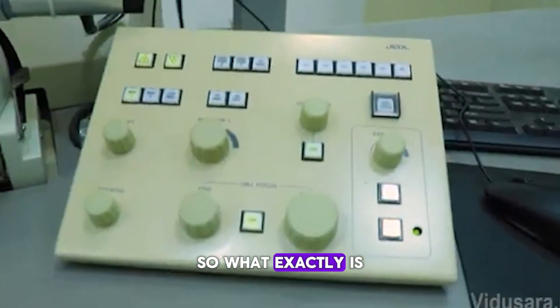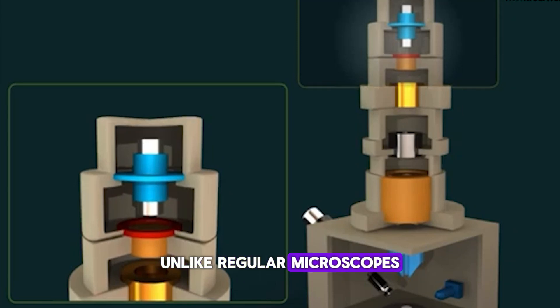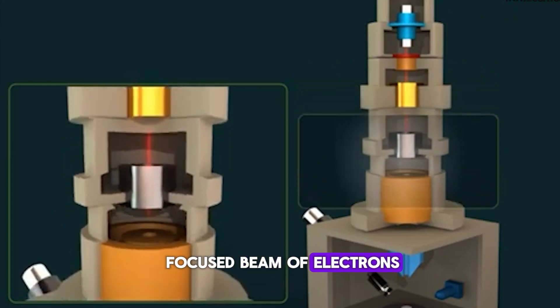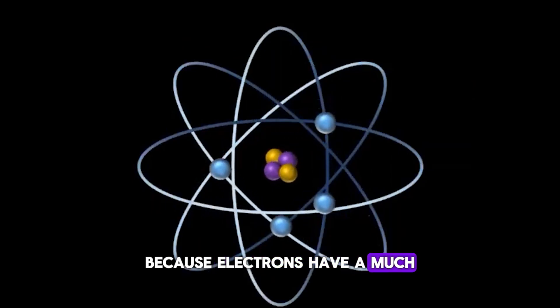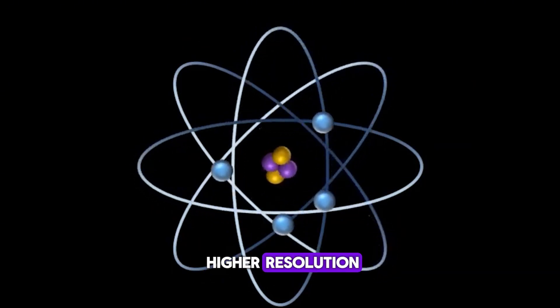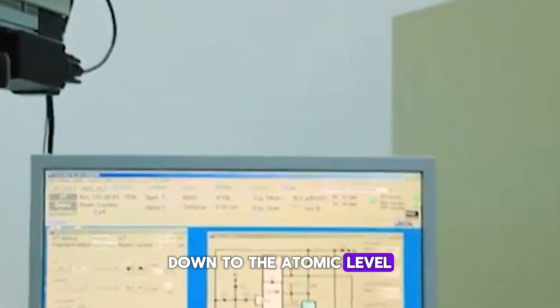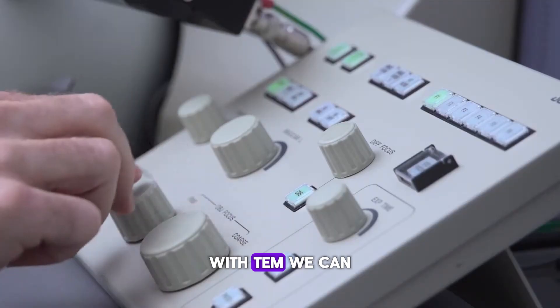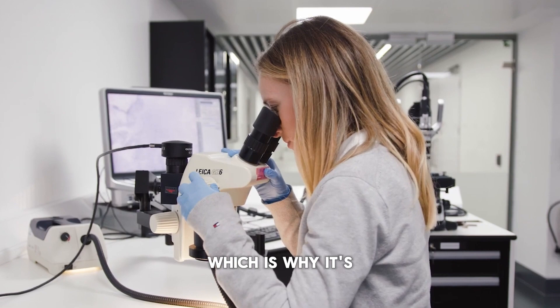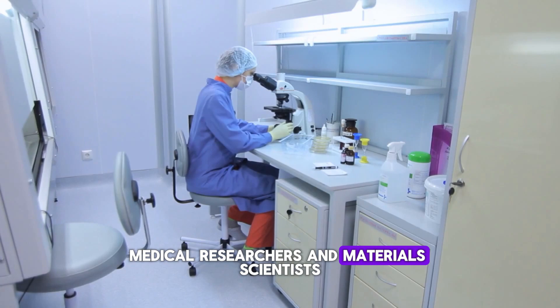So what exactly is a Transmission Electron Microscope? Unlike regular microscopes that use light to view samples, the TEM uses a focused beam of electrons. Because electrons have a much smaller wavelength than light, they provide a much higher resolution, allowing us to see even the tiniest details down to the atomic level. With TEM, we can magnify objects up to two million times, which is why it's such a valuable tool for biologists, medical researchers, and materials scientists.